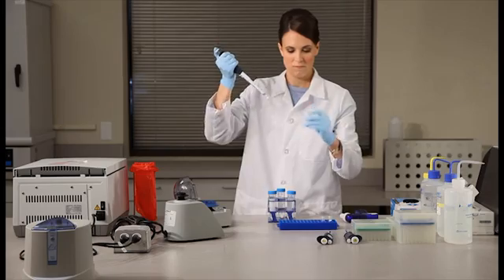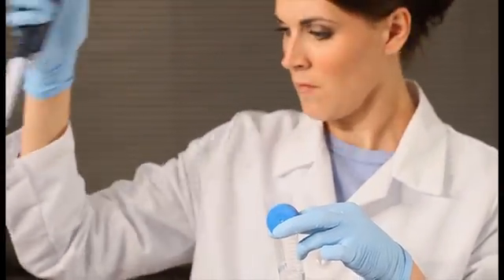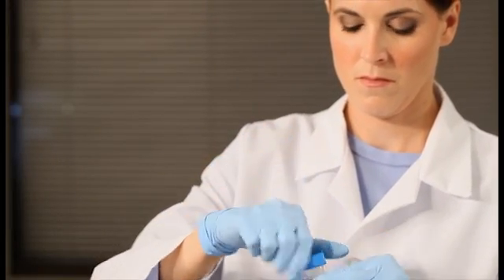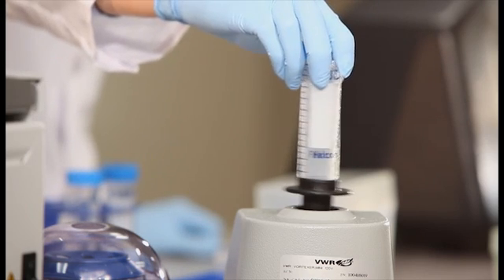For convenience, this buffer may be prepared up to one week in advance of use and stored in the refrigerator. Before each use, briefly vortex the bead beating buffer to mix.